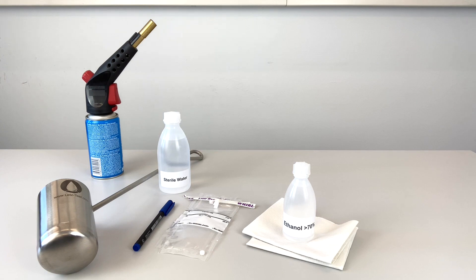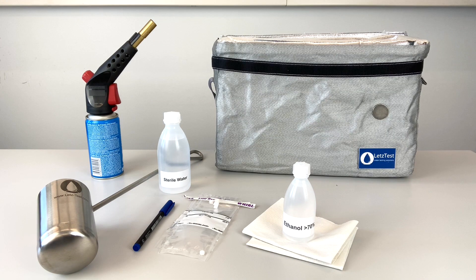If possible but not mandatory, bring a portable Bunsen burner to disinfect parts. Bring sterile water that you know does not contain bacteria to control the quality of your sampling technique.